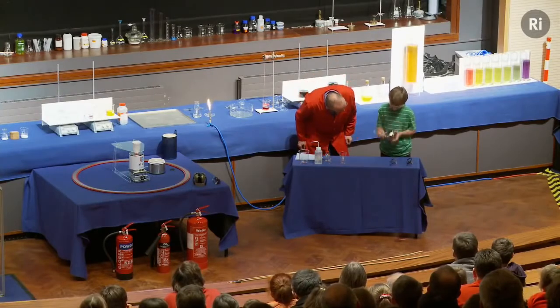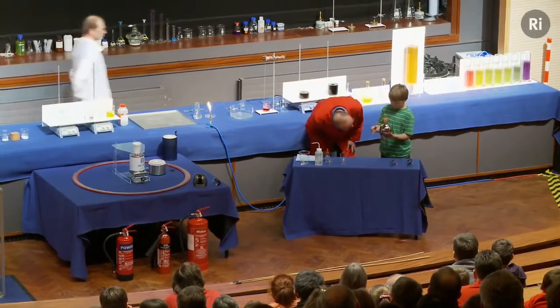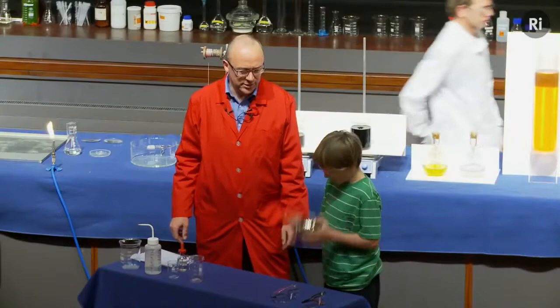Doing really well. Okay, let's just have a quick look. Almost there. Keep going a little bit longer. Still looking a little bit dark.